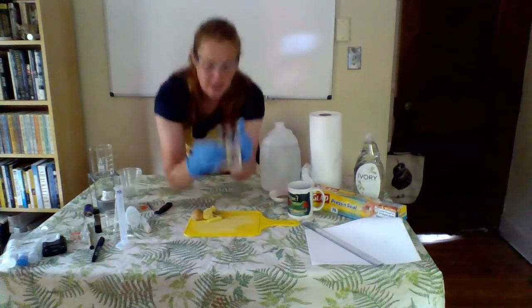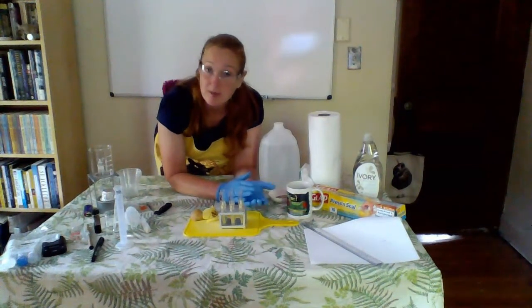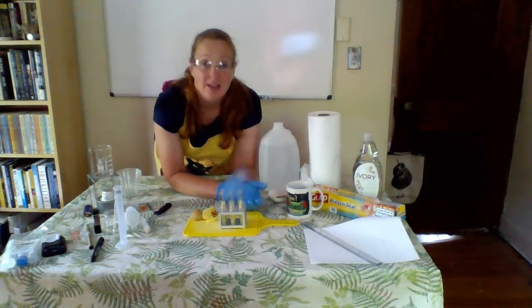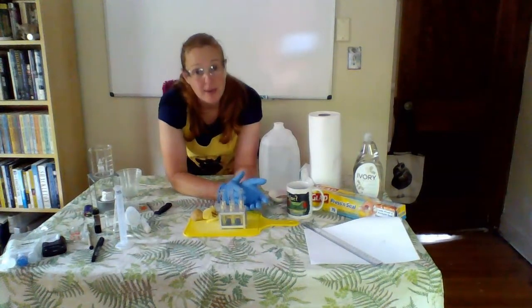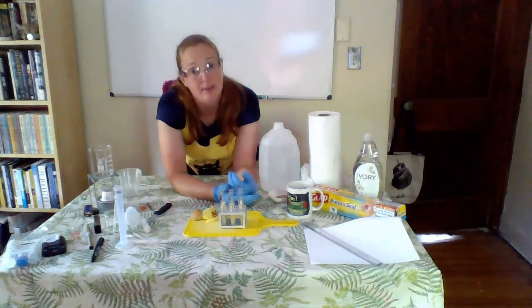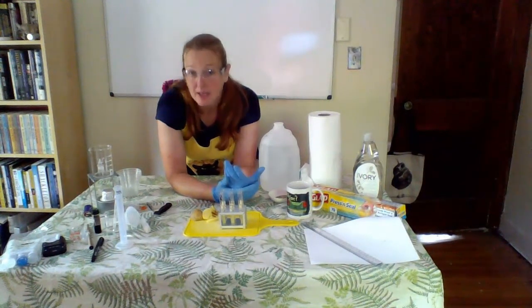So that means that not only did I fill my test tubes up with the right amount, or at least the right volume of liquid, but my potato chunks also have a lot of consistency. That consistency is going to help me to determine what's going on in my experiment. Remember, whenever we set up an experiment, we need to know that our dependent variable, in this case, the weight of our potato at the end of the incubation period, is due to what we changed and what we manipulated and not due to anything else.